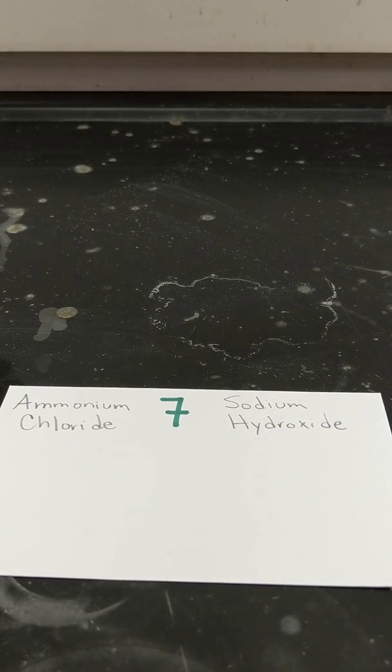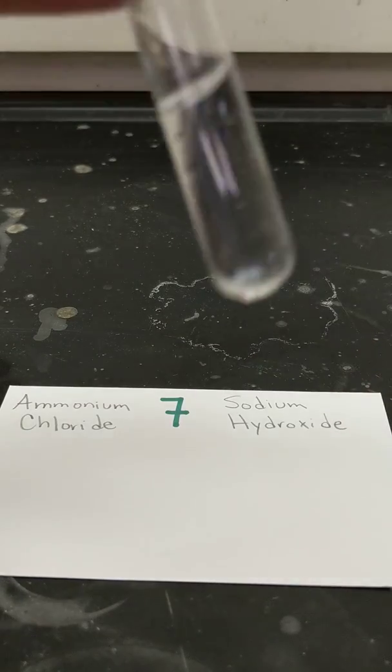Reaction 7, ammonium chloride and sodium hydroxide.